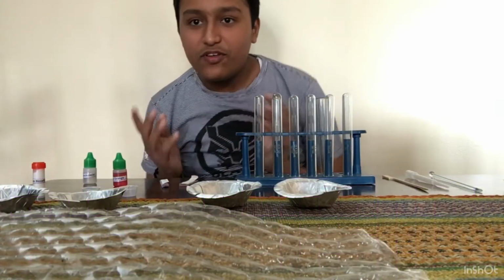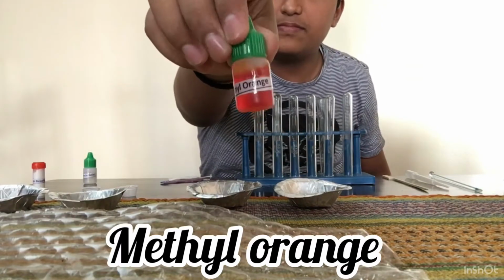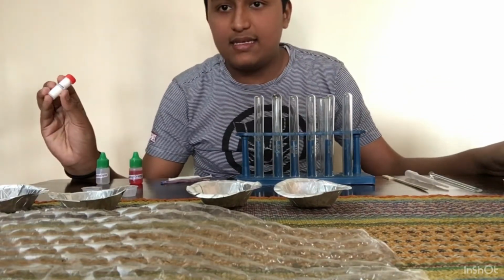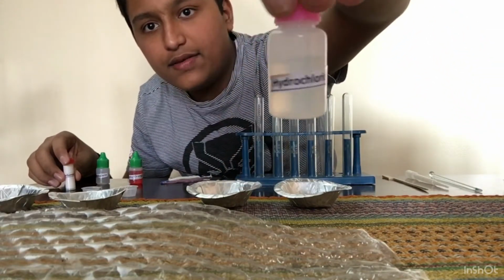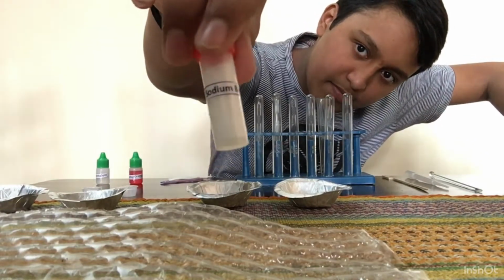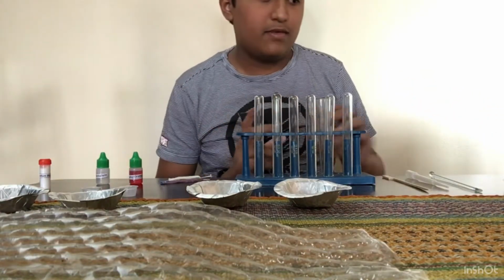So, here I have three indicators with me: the blue and the red litmus paper, the methyl orange, and the phenolphthalein. And I have one acid and one base. So here is one acid, hydrochloric acid, you can read hydrochloric acid, and this is the sodium bicarbonate. Sodium bicarbonate.